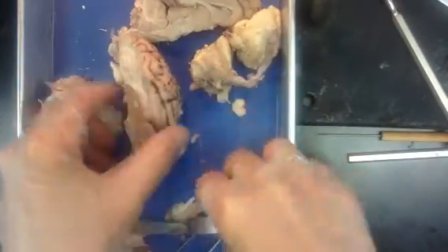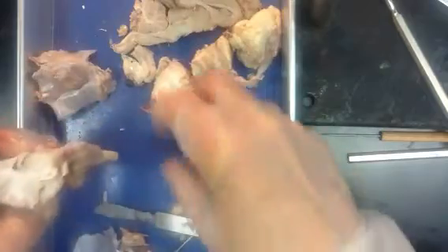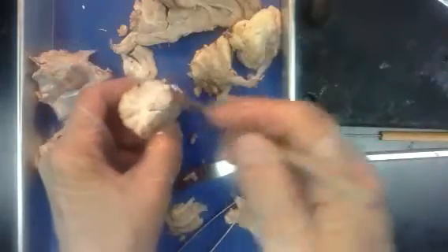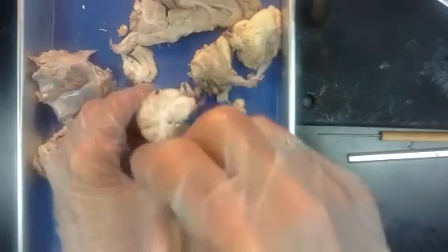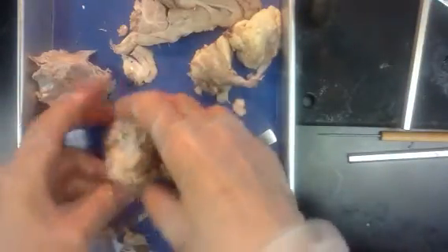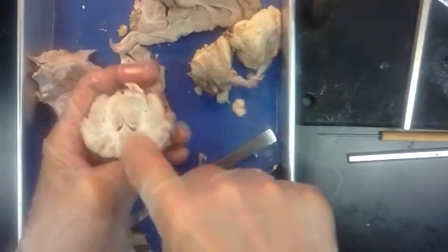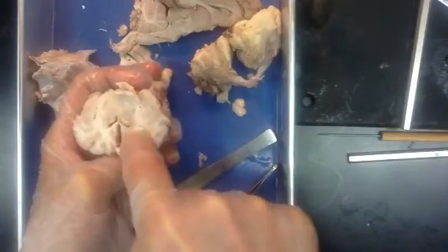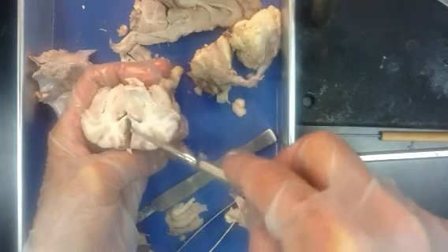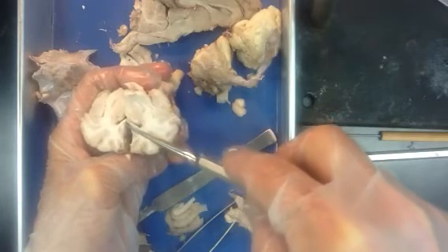Other than that, you may want to cut the brain in a coronal section or frontal section and then take a look internally. This way you can see a ventricle right here, a lovely ventricle. And actually, if I put those together, let's see if we can see where a commissure goes across there. Okay, here is the corpus callosum, the white that connected across. Here's a ventricle on each side, the two lateral ventricles, and here is the longitudinal fissure that comes right down to the bridge. And if I hadn't cut this, this would have been solid white right across here.